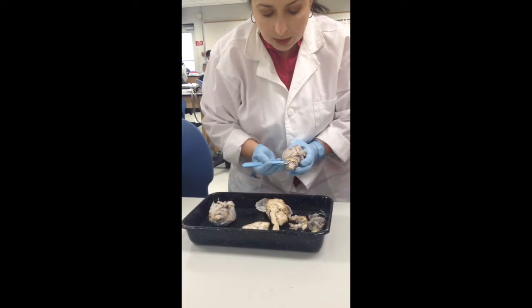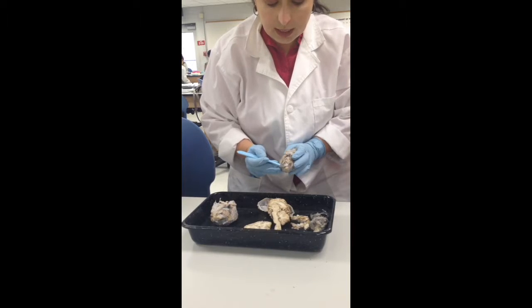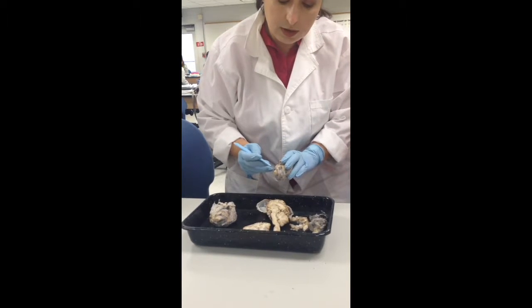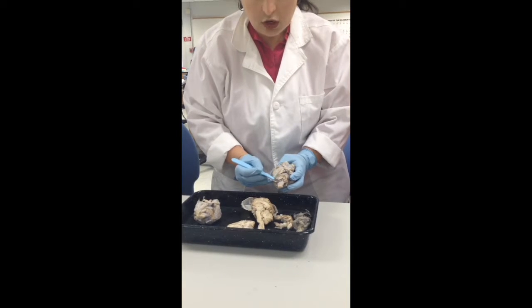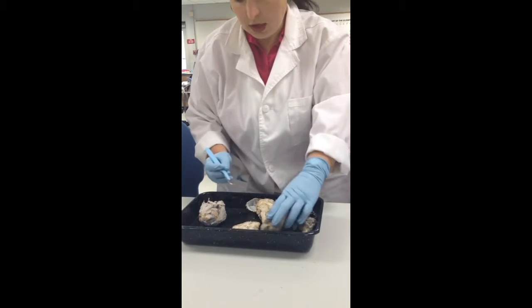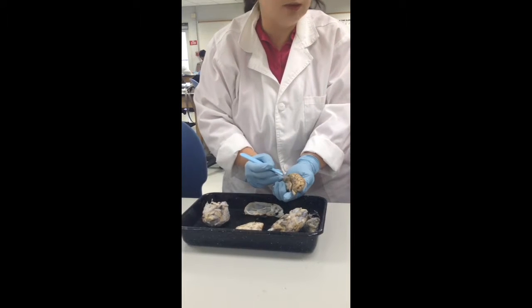Now there's other nerves that are really, really tiny, and they look like little hairs. Like there's one right here. Okay, some of them, the ones over in this region would be like your 10, 11. You can see a little bit of it coming out right here. Okay, and then all these black lines are blood vessels. So the same thing over here. These are going to be blood vessels, most likely carrying arterial blood.